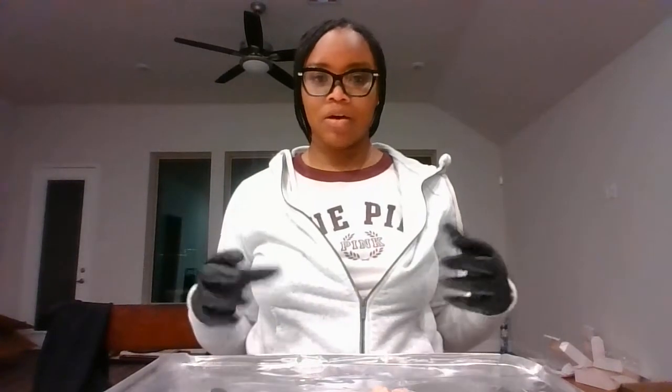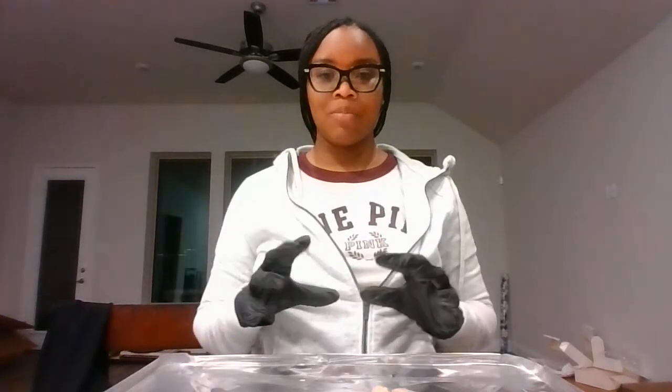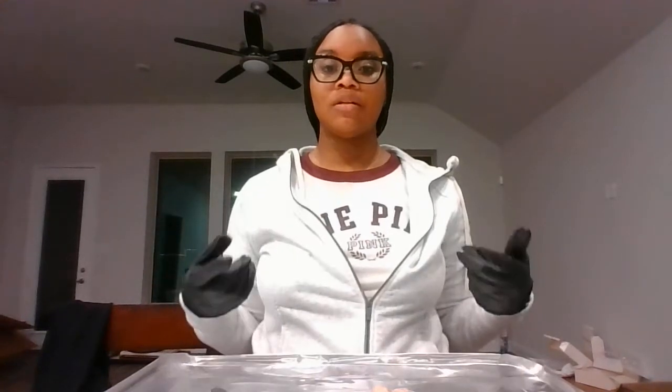This is my sheep dissection part 2. In this video, I'll be covering about 20 parts of the brain, including their functions.